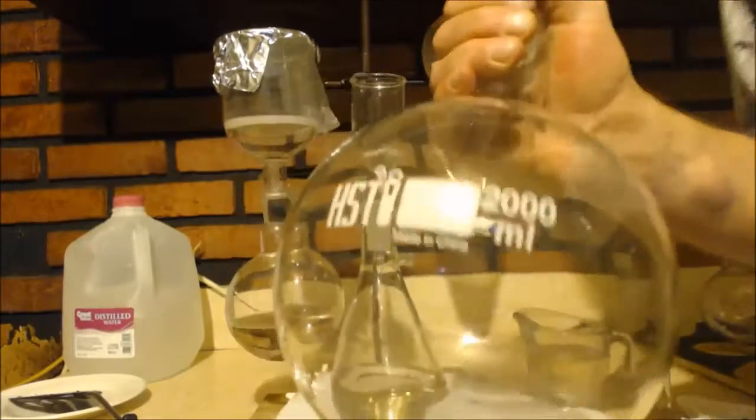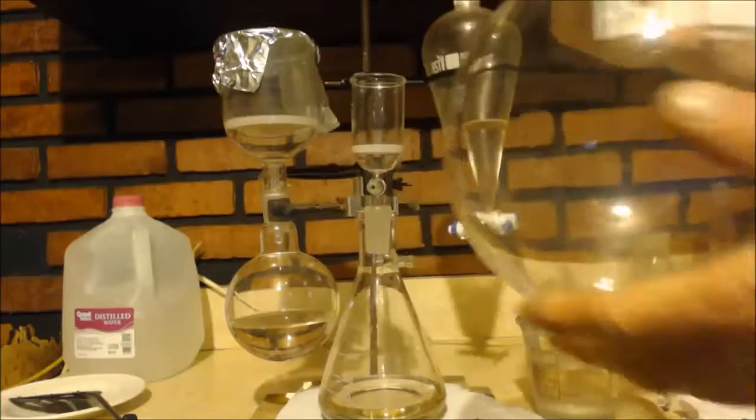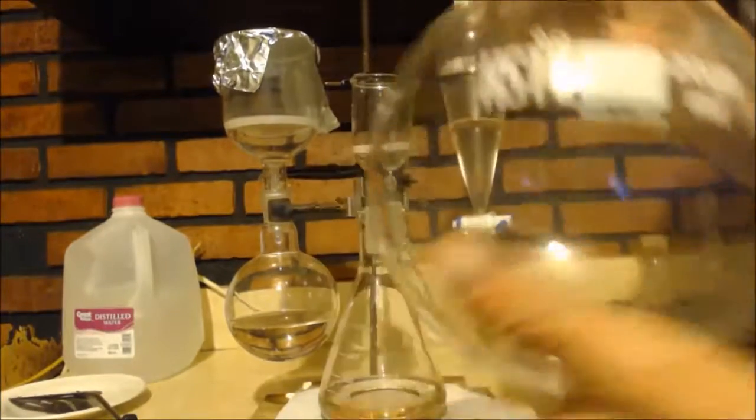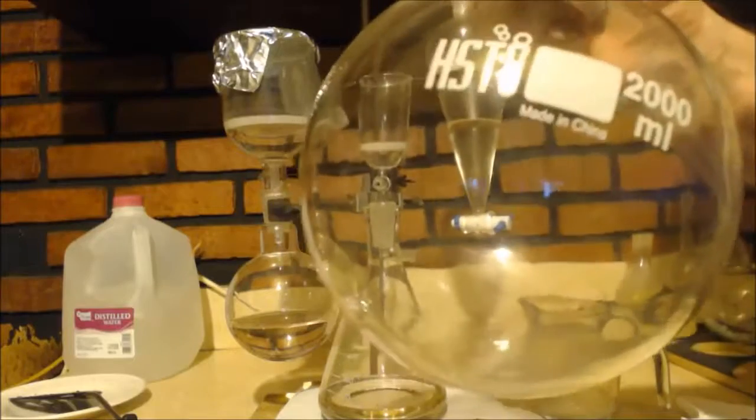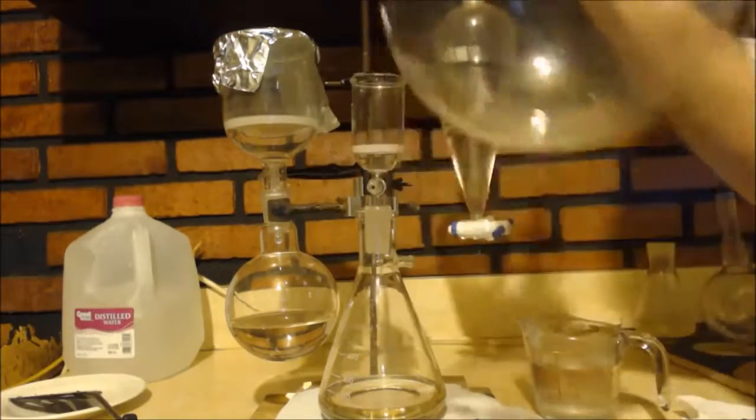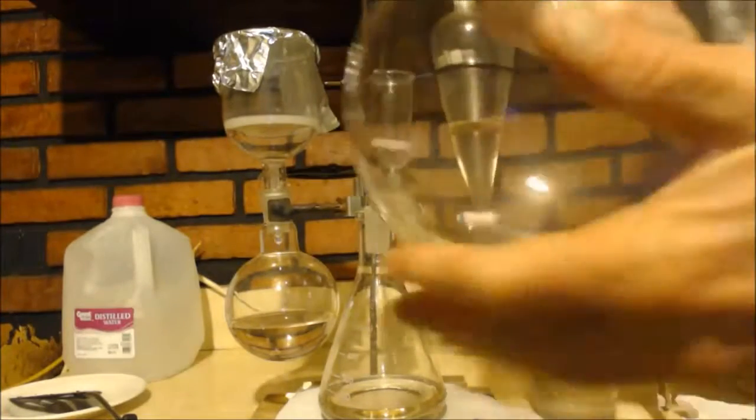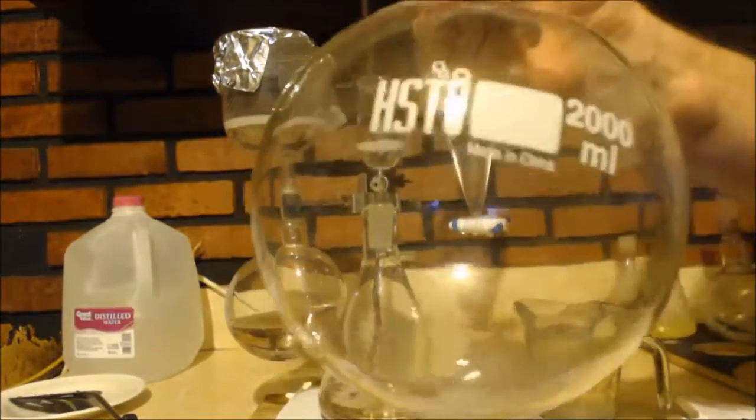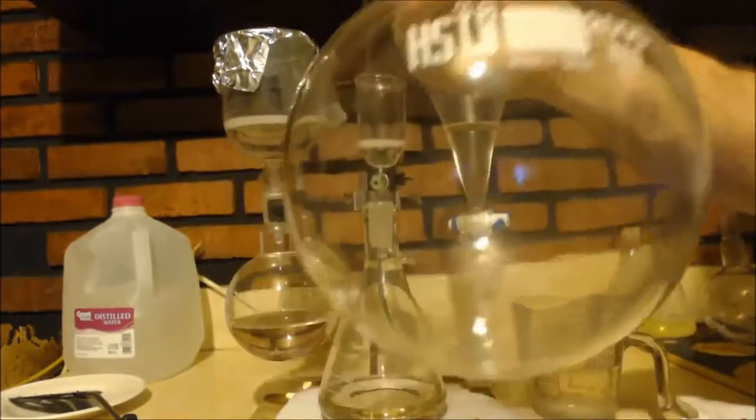You notice I used this big giant 2000 milliliter flask in between my pump and my glass apparatus, right? And I had the two valves on it. These two valves, one led to the apparatus and one led to the vacuum pump. And I did that because of the valves. The reason why I used such a big flask on the bottom, because when you, I mean, it's not necessary, but it's a good idea. When you use a vacuum, like a vacuum pump, like a strong vacuum, you should always add some volume to your glass apparatus. The reason why is because there are fluctuations on those pumps. It's not like it keeps an exact pressure all the time. And the fluctuation, the bigger the room is, or your apparatus, the less abrupt it is. Especially when you have it way over by the pump, it's going to hit this first, that pressure change, and then evenly distribute it out more as it moves through the system. So if you have a big round-bottom flask, that helps to buffer that.